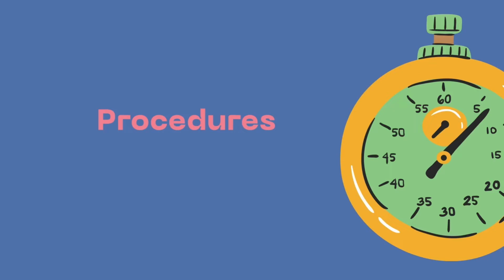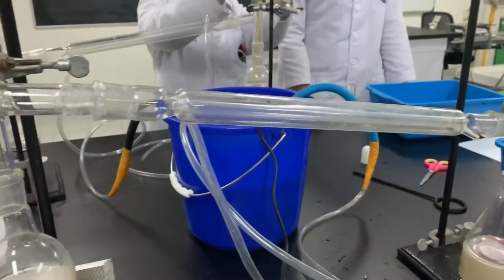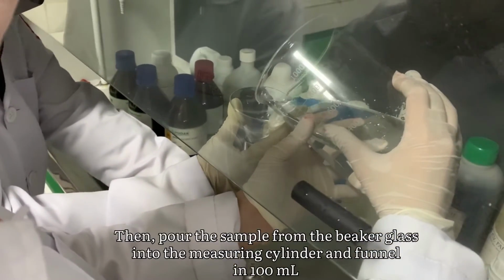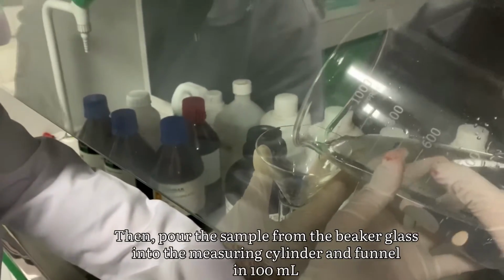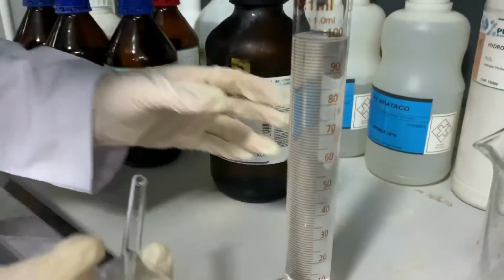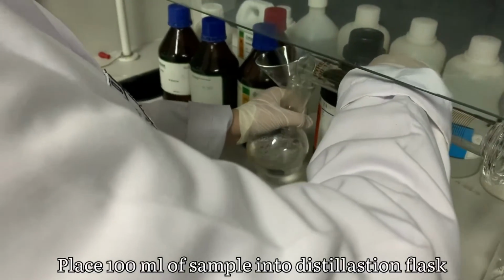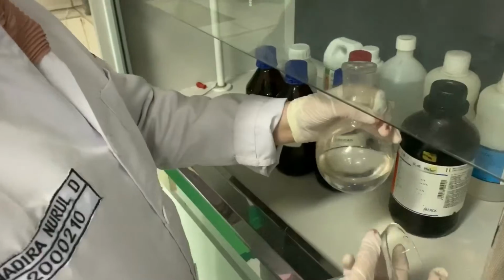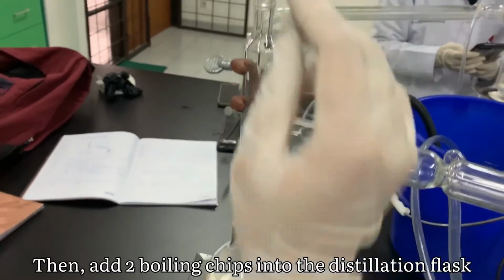So, let's see the procedures. First, set the distillation apparatuses. Then, pour the sample from the beaker glass into the measuring cylinder with a funnel, 100 ml. After that, place 100 ml of sample into the distillation flask. Then, add 2 boiling chips into the distillation flask.